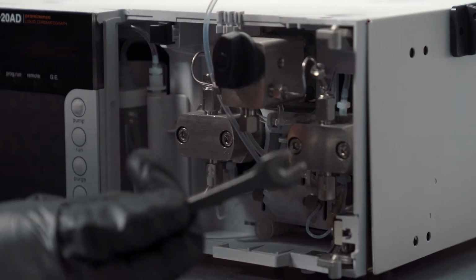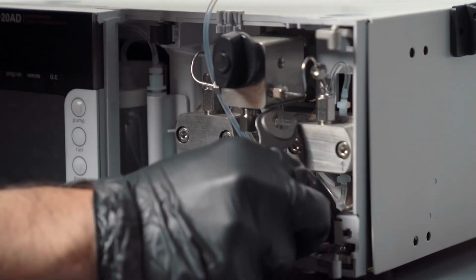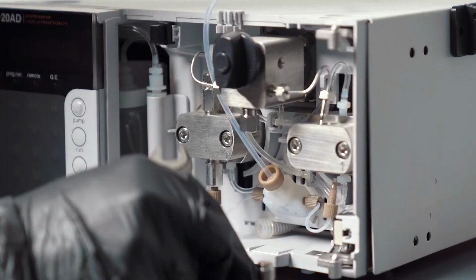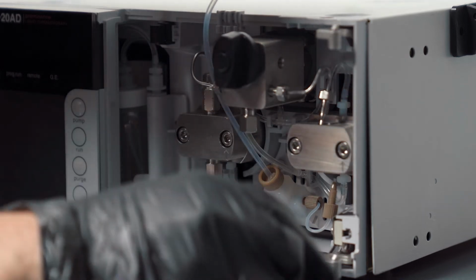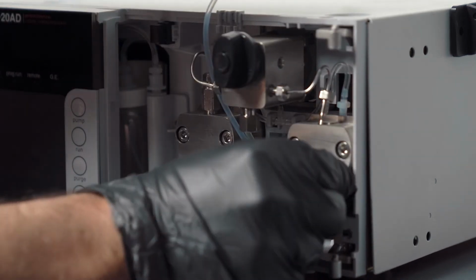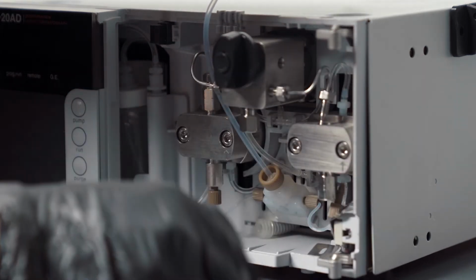Now you have the 10mm wrench. So now you can take these off. All right, so that's one guy. And then let's unscrew here too. See that? So there you go. And then when you want to replace the check valves, it's the same thing. Just put it in. You want to be careful you don't over tighten too. That's a common problem too. Just snug. And then over here.